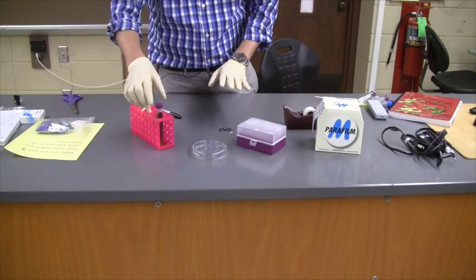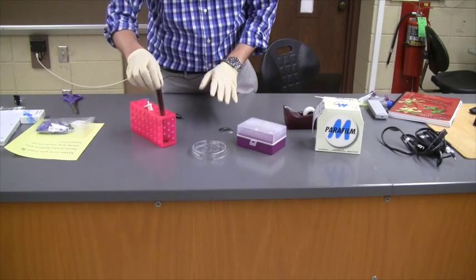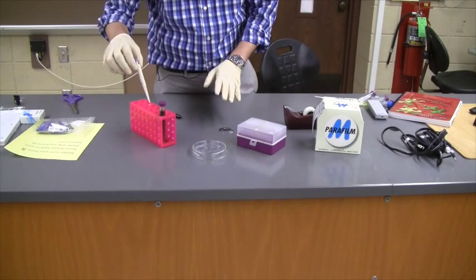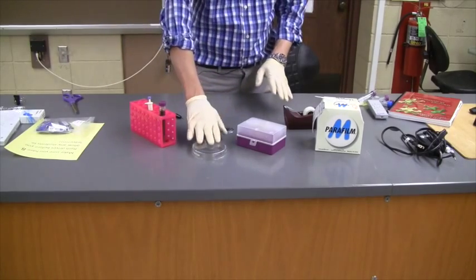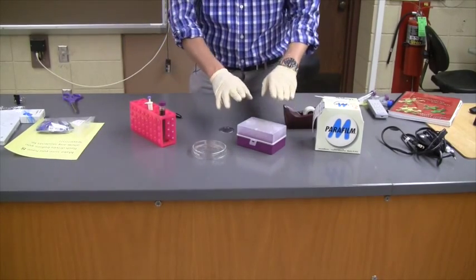I have a sample of bacteria in a broth, a micropipette for 50 microliters, my petri dish, and my micropipette tips.